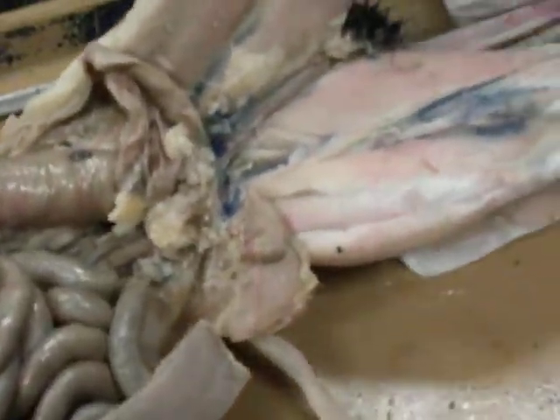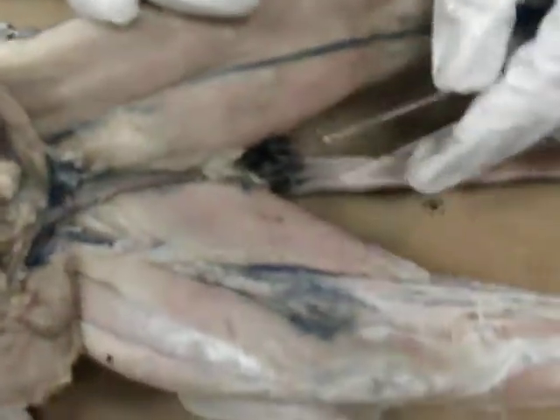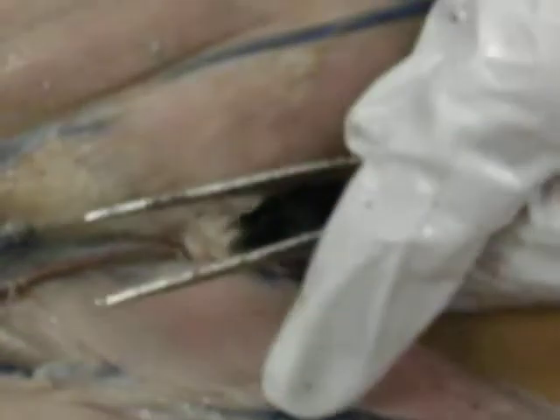All right. So then for the male parts, we have our fur-covered scrotum. These 2 back parts here. If you take the fur off, then that would be the testes. This one seems a lot smaller than that one. Okay. Yeah, a little bit. So then the front one here is actually the urethra that comes down, and then it forms into the penis. So the urethra is going to be up here, but the actual organ is going to be here.